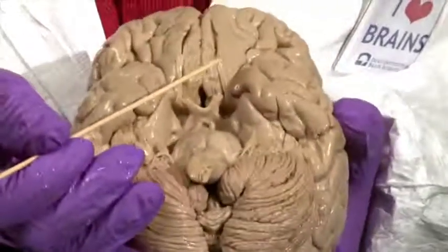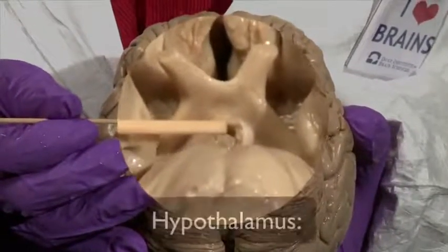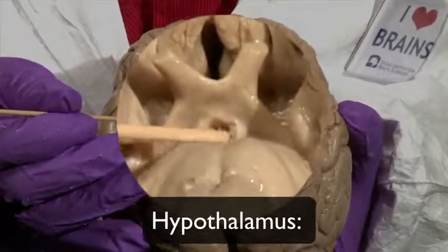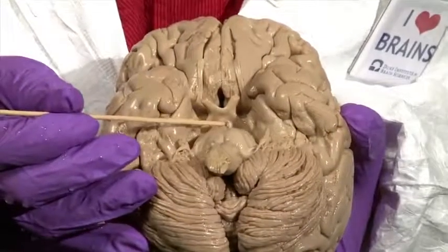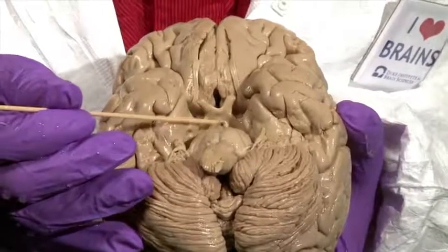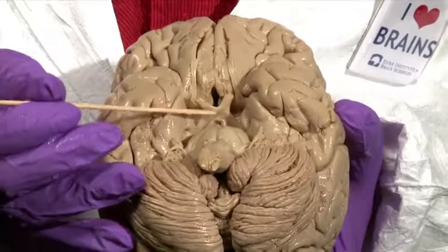Just behind the optic nerves is the floor of the diencephalon, or the ventral surface of the hypothalamus. And there's a bit of a hole in this specimen, which is where the stalk of the pituitary attaches to the hypothalamus. That stalk was removed, and in its place we see a little bit of a hole that allows us to look through into a space that sits right in the middle of the hypothalamus called the third ventricle.